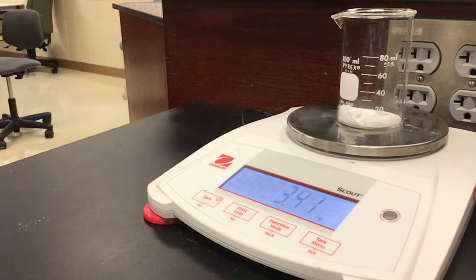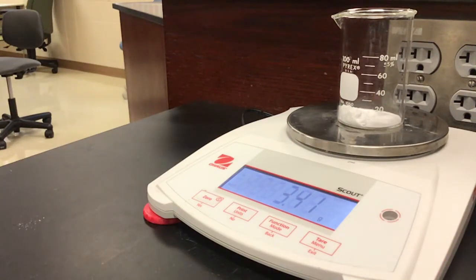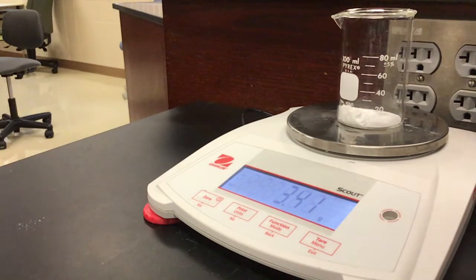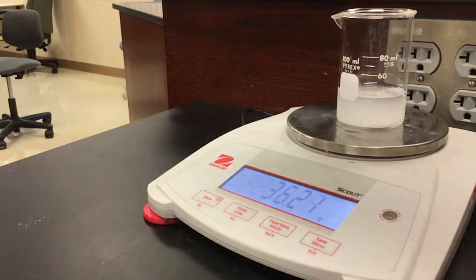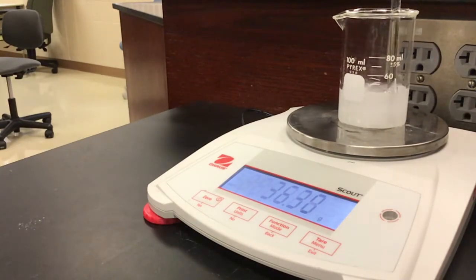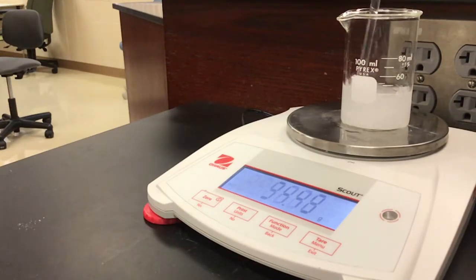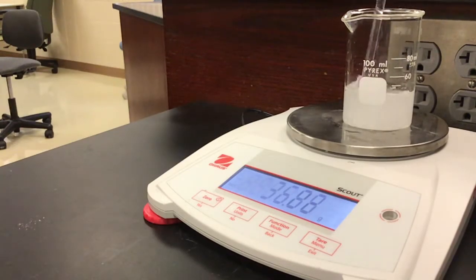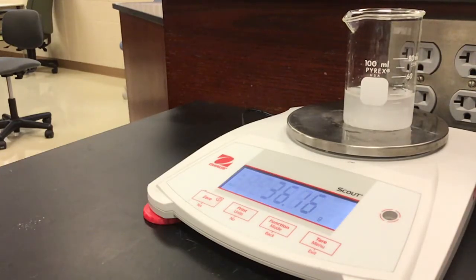Now what I'm going to do is mix the salt with the water and stir gently. The total mass of the salt and the water should be what we see here. The question is, as I mix these things, will the mass change — will it go up or down? So 36.16 is your total mass there.